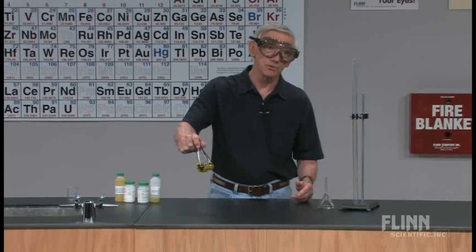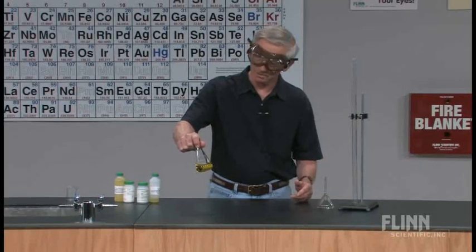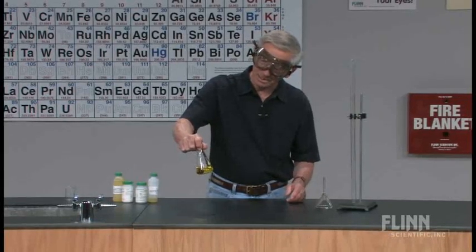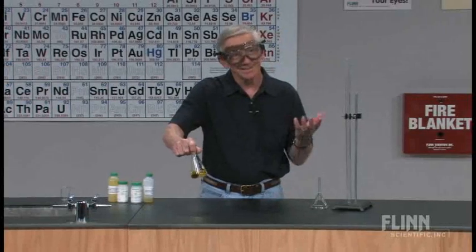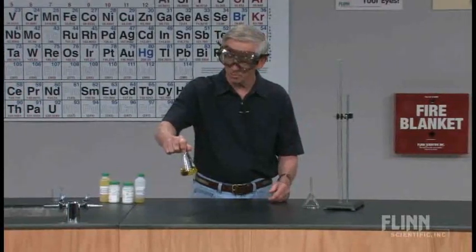Vanadium gets its name from the Norse goddess of beauty, Vanadis. So we're going to see some really nice colors here. And to a large extent, that's the whole purpose of this demo.